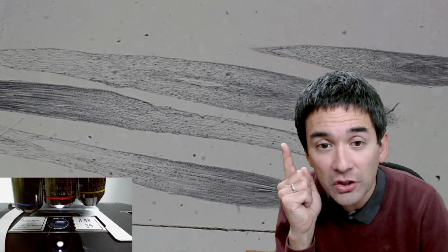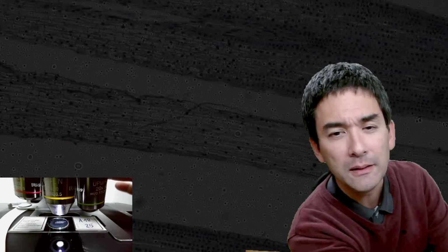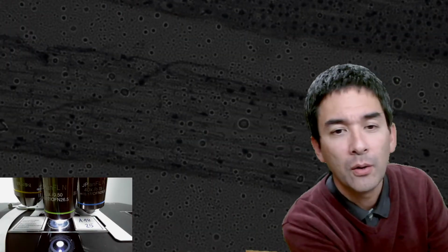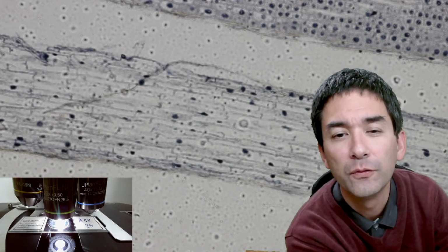Okay, I'm going to do something else. I'm going to start here at the end because I want to show you something that might surprise you a little bit, but it explains a few things as well on how microscopic specimens are made. I need to make it a little bit brighter now. I need to refocus.